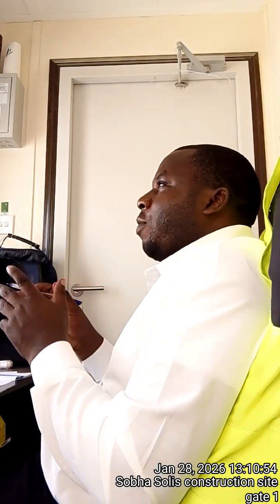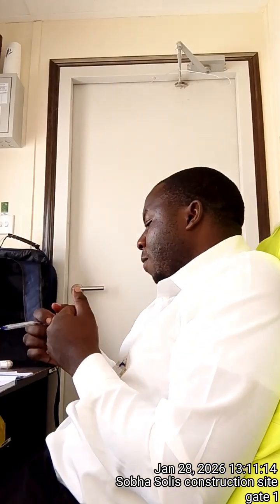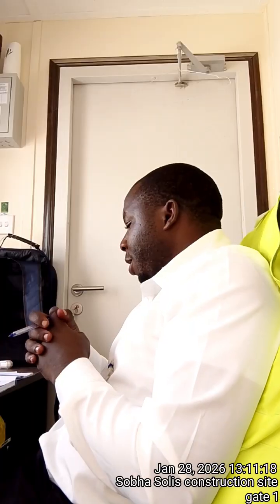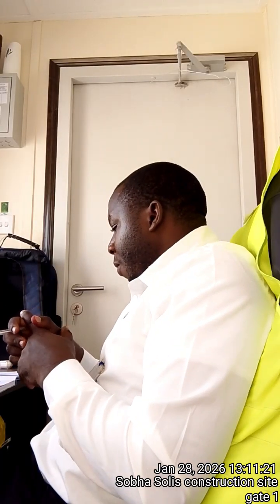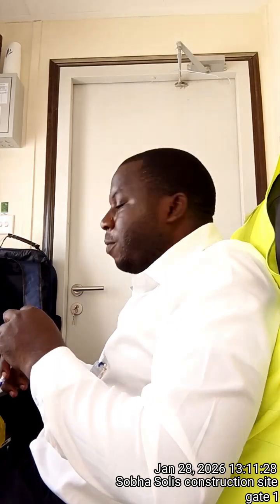So in my explanation, I will say carbonate ions react with acetic acid to produce carbon dioxide gas, which appears as bubbles. So whenever I see bubbles appearing, this one confirms the presence of carbon dioxide gas, and this one automatically tells us that this water has carbonate ions. So in my conclusion, that is it. Water will be there as a product. We shall have carbon dioxide, we shall have water, and maybe a salt. That is my observation for the first assignment.